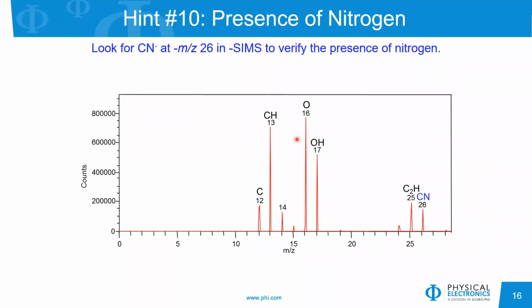You can confirm the presence of nitrogen in your sample by looking at the negative ion polarity. And if there is nitrogen present, you will see a fairly strong peak at a mass to charge ratio of 26. So this is the CN minus peak in the negative ion polarity. So a good confirmation that your molecular ion in the positive polarity might contain nitrogen.